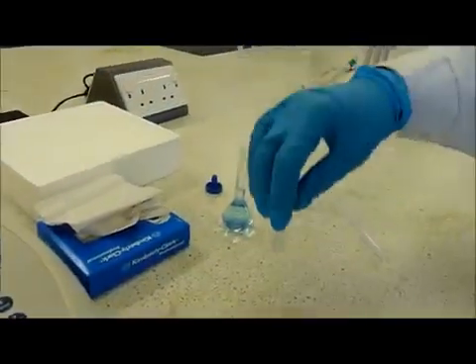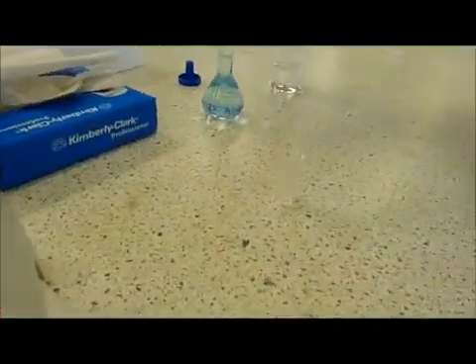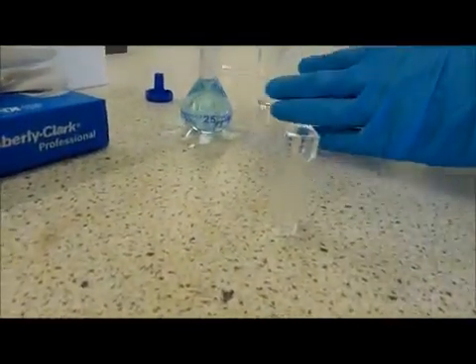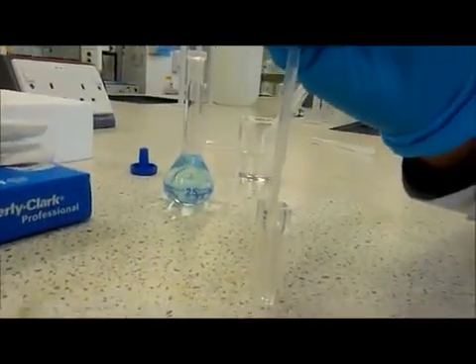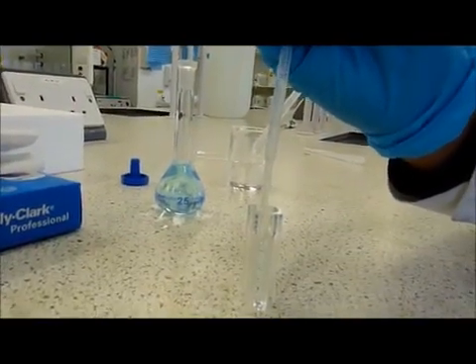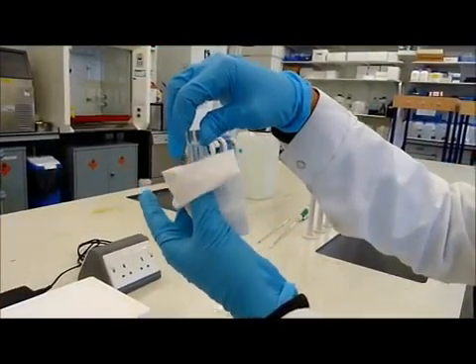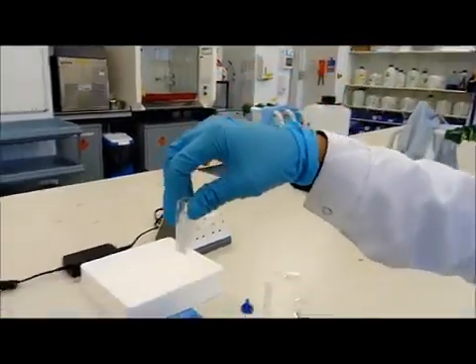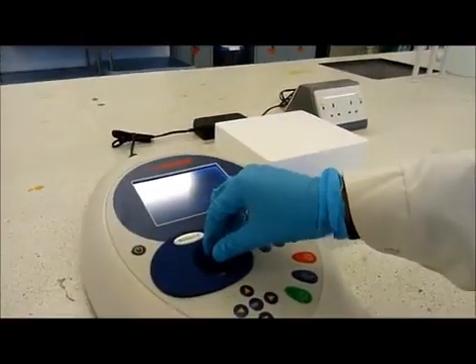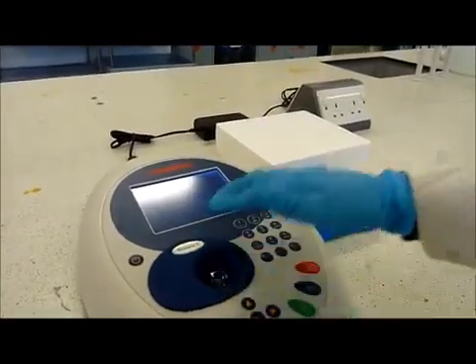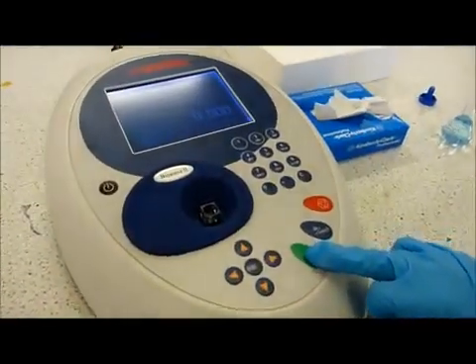Prepare another cuvette with sample. Ensure that it is nice and clean with no air bubbles and again place it correctly in the holder. This time press the green button.